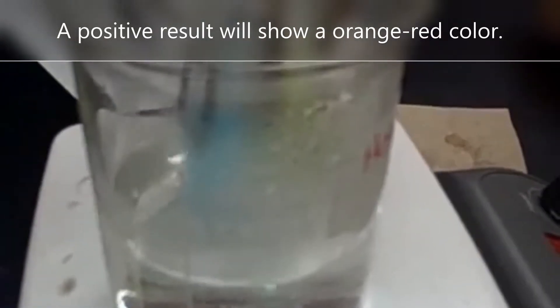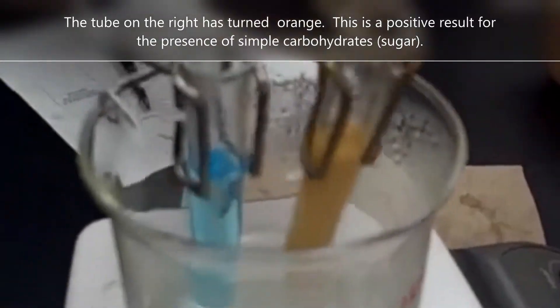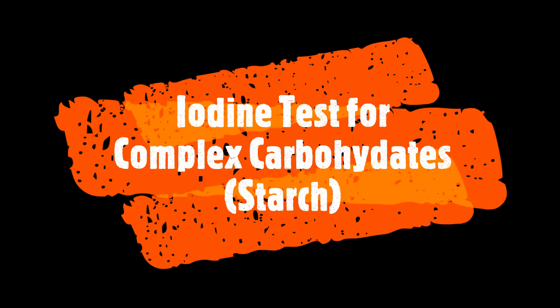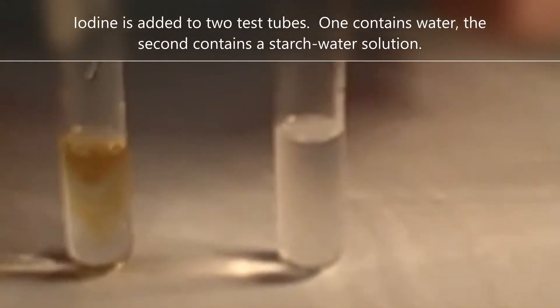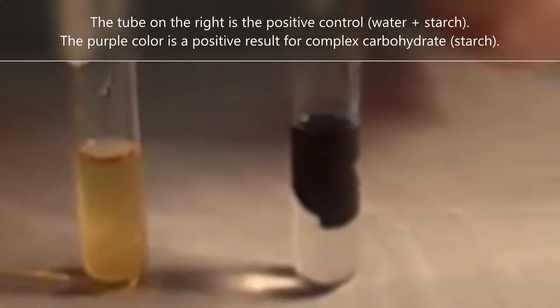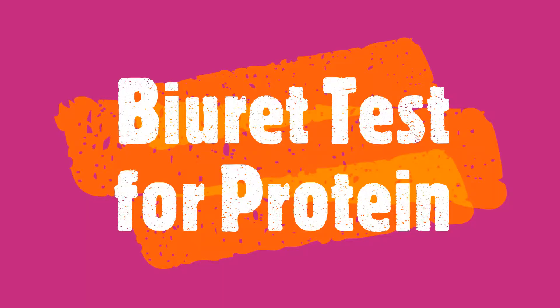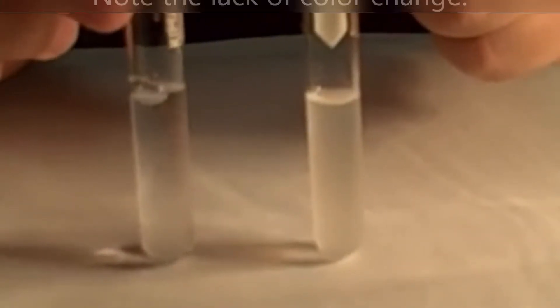Oh my god, it's green. Okay, keep going a little bit longer. It's turning yellow. Now it's yellow, it's almost done now. Okay, you can go ahead — it's over by the paper towel dispenser. Go ahead and take them out. It's orange.